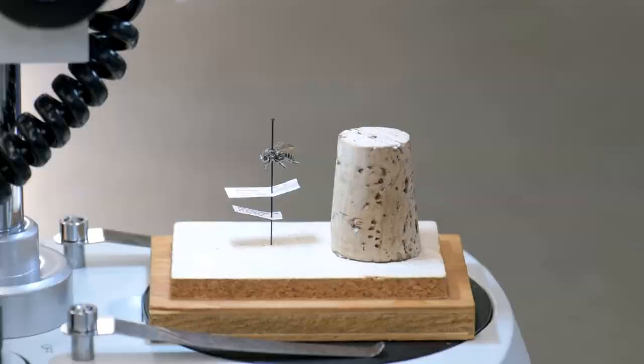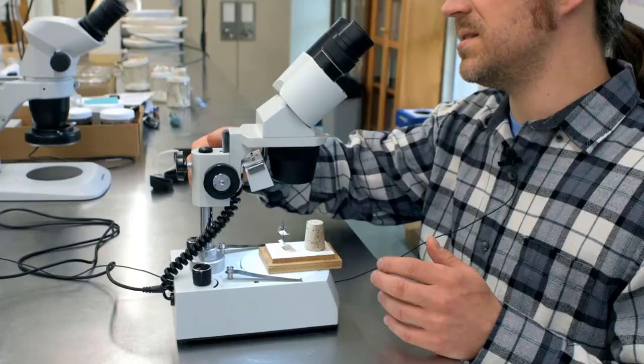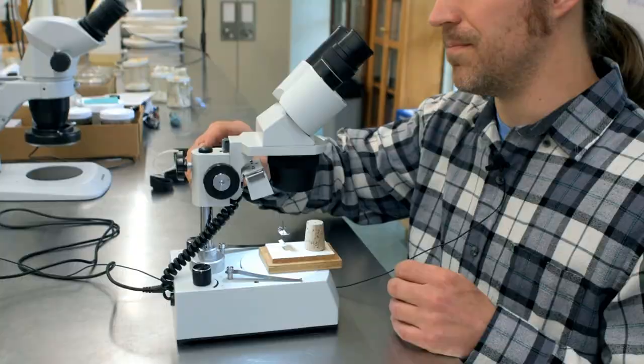Once you've got a specimen under the microscope, you'll want to adjust it so you can see it in focus. The first adjustment is the coarse focus, which raises the head of the microscope up and down — that is a very coarse way to adjust. Other microscopes will also have a fine focus that can let you zoom in even closer at a finer scale.